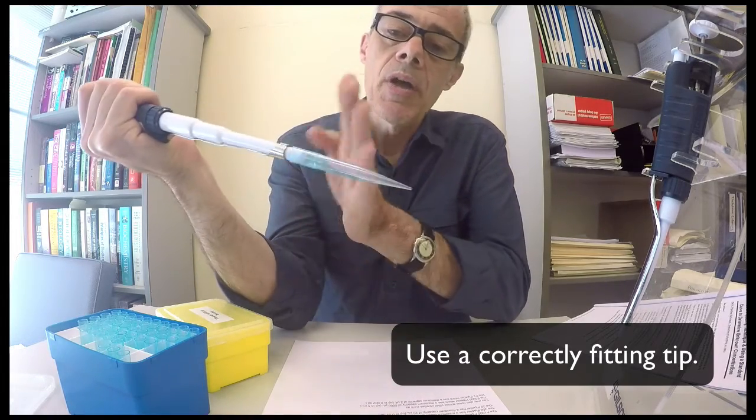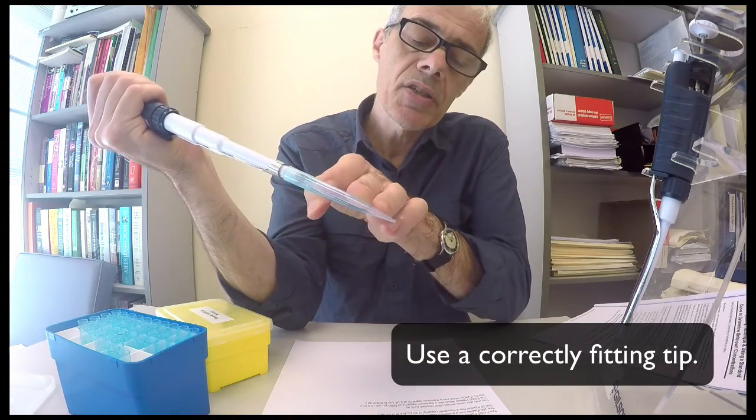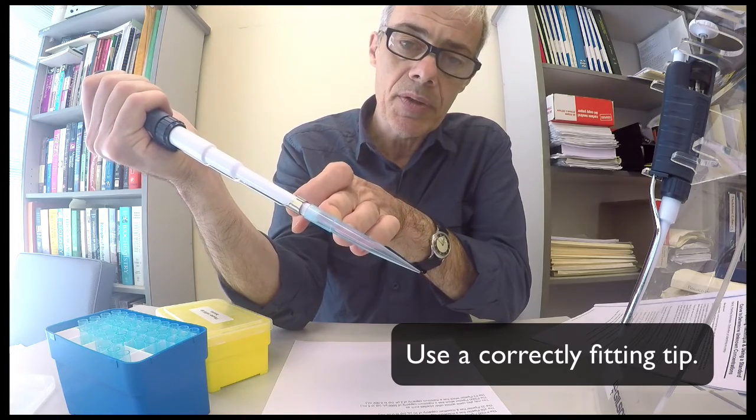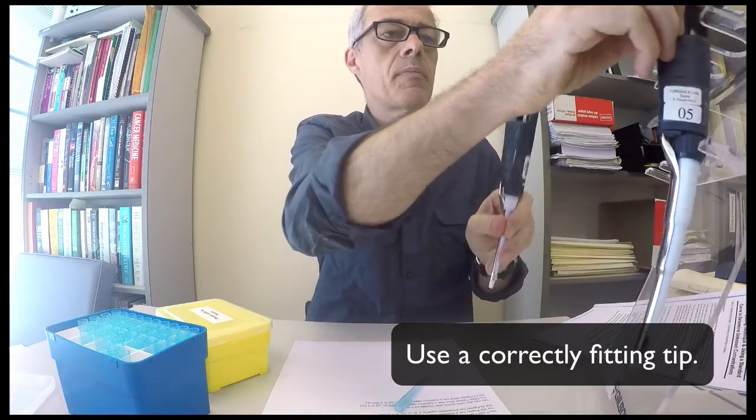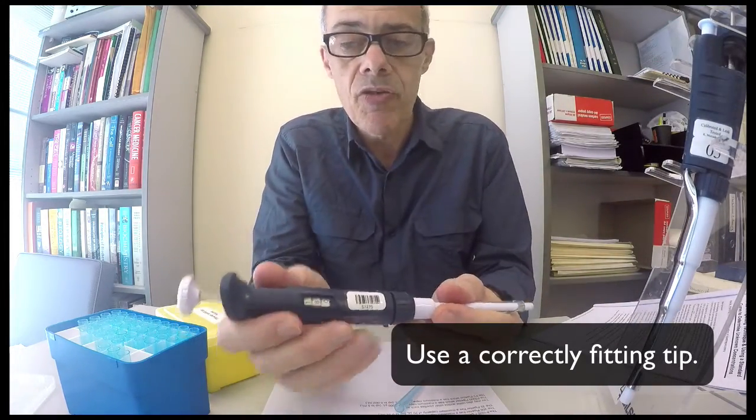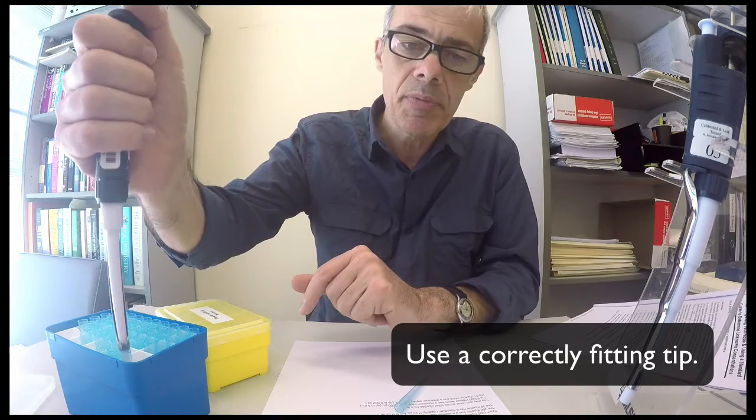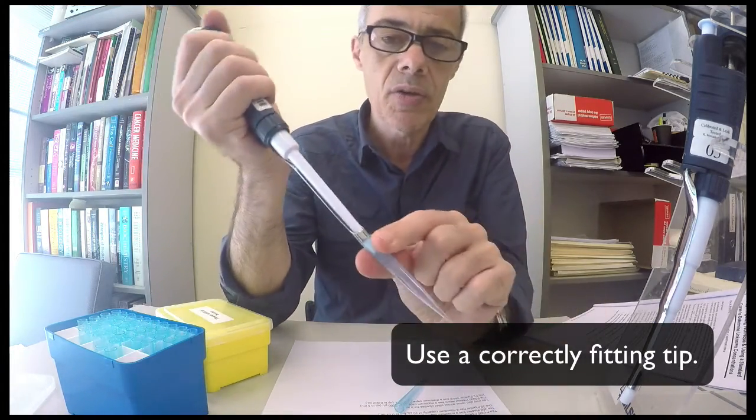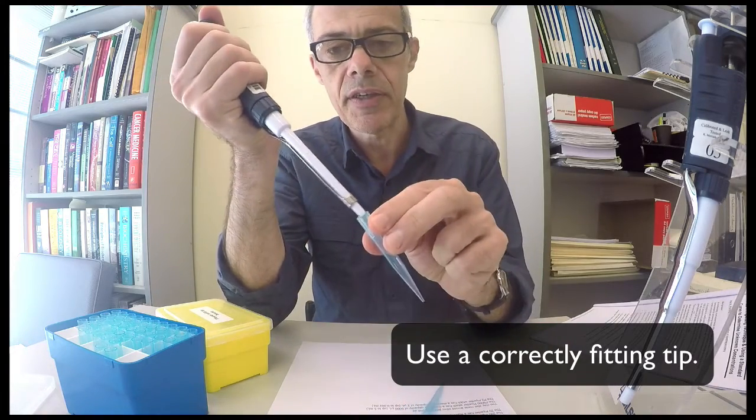So this large plastic tip fits the P1000. If you try to take the P200 onto the blue tip, it's not going to fit. Clearly that is not designed to fit.